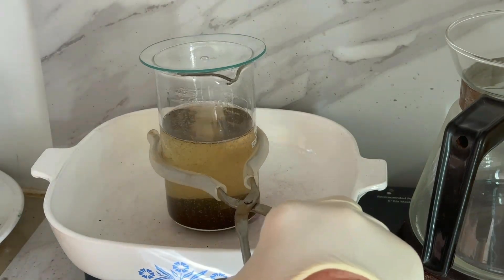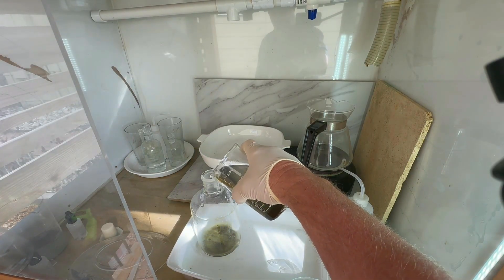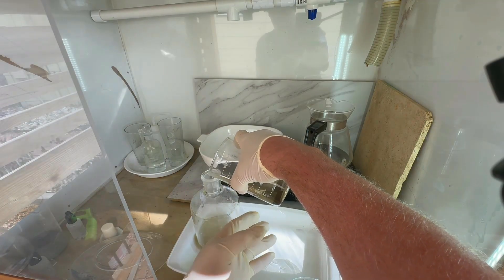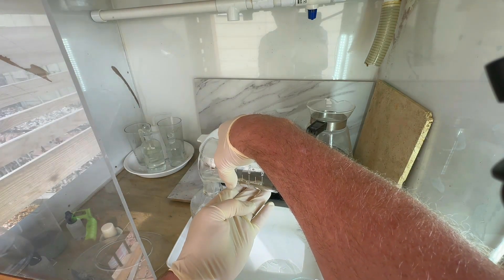It's about 30 minutes on low heat — you can see the gold has settled to the bottom. I'm going to decant off the liquid and wash this up, starting with the hydrochloric boil followed by some boiling water washes. Then we'll set it up on the low heat to dry before we weigh it.